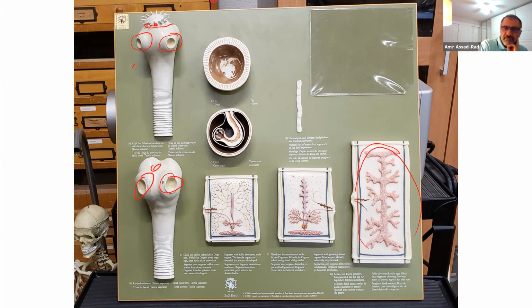Uterus full of eggs. This is a mature proglottid, right? Uterus, and then you have the ovary, and right here are the yolk glands. And this one, same thing again, full of testes. Yolk glands are a little bit mature. And this is the egg, and of course, this is the cysticercus.